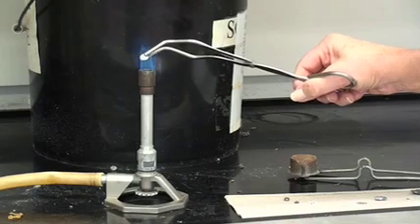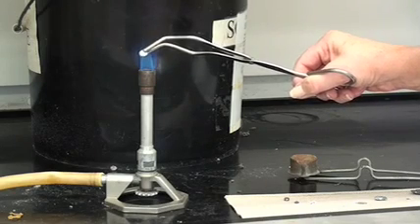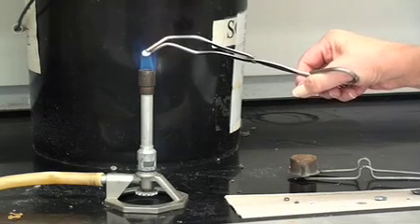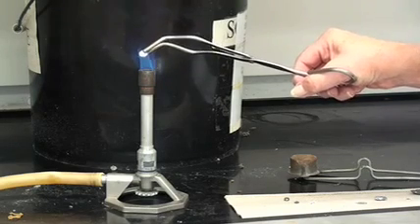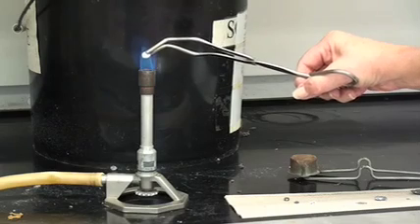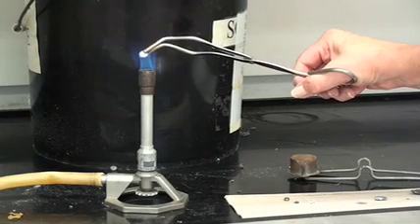And while I'm seeing a couple of flickers they're not in the super hot flame. We'll keep holding on to this for a little while. The surface does appear to be getting a little whiter.